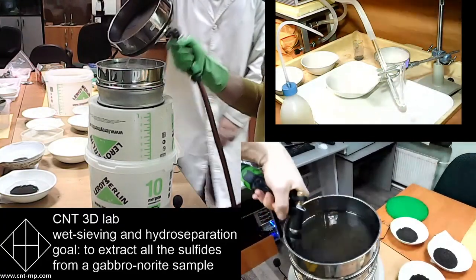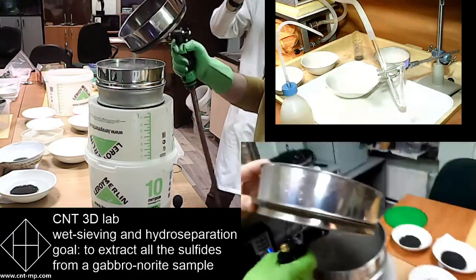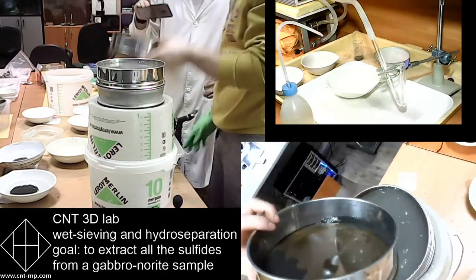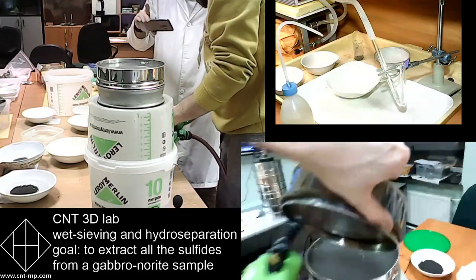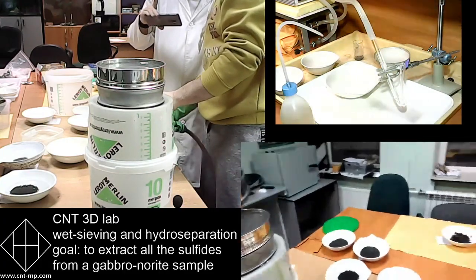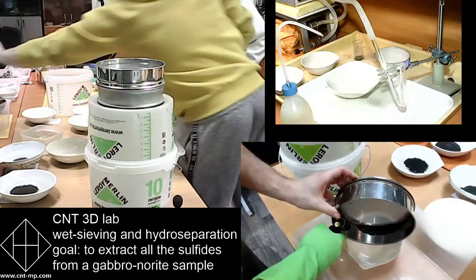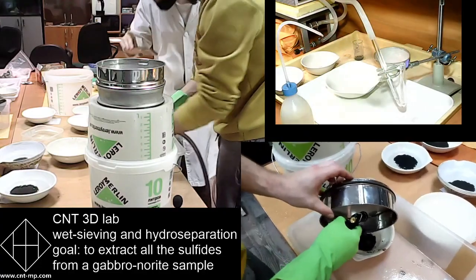He does the same with another sieve, same approach, rubbing it by hand and washing it in the sieve below. So that might be the 250 microns sieve.